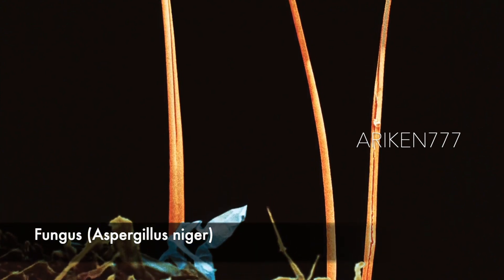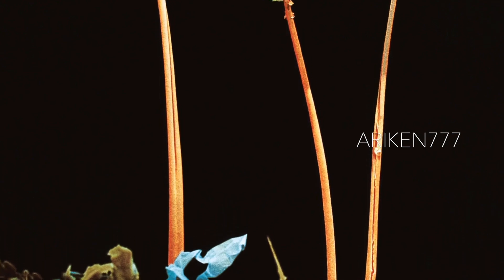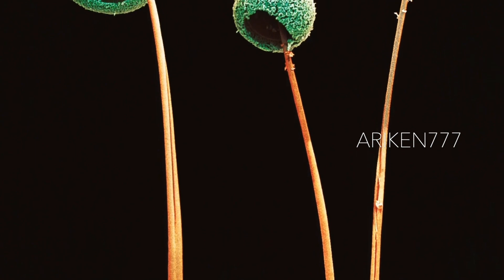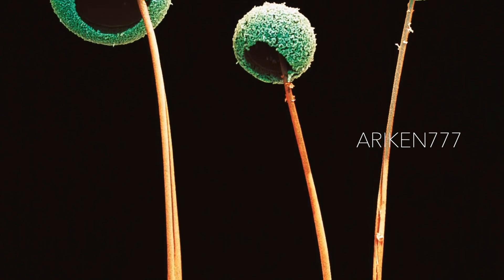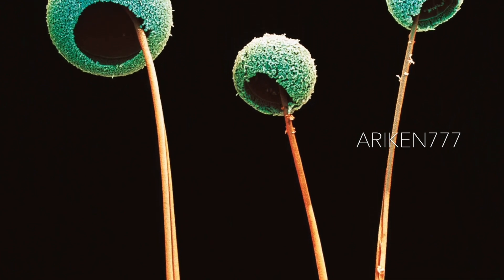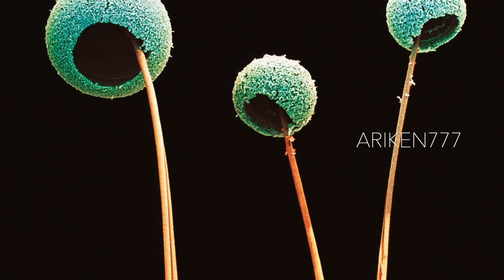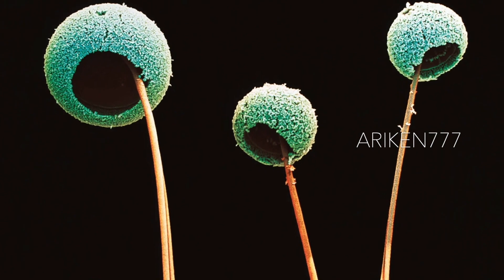There are several hundred species of Aspergillus fungus, and all of them form mold found on plants and starchy foods. They reproduce through spores at the end of stems. The fungus seen here is Aspergillus niger, which forms almost completely spherical spores radiating outwards from the tip of the stem.